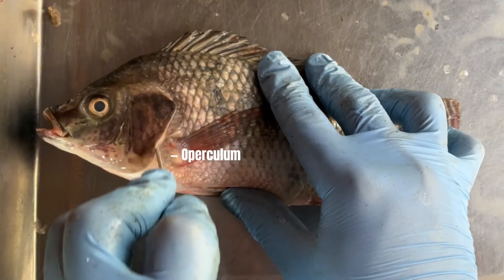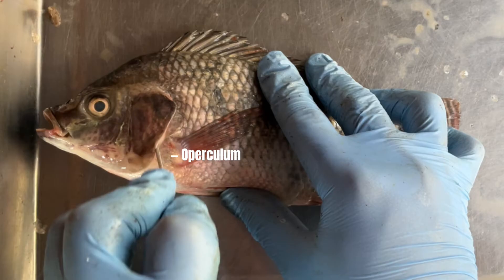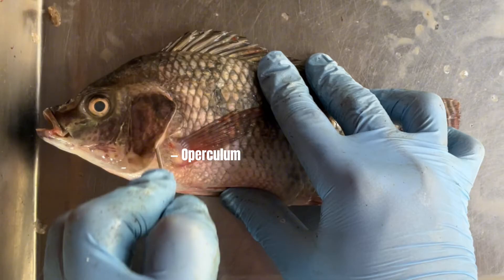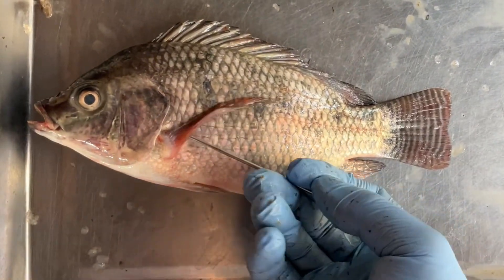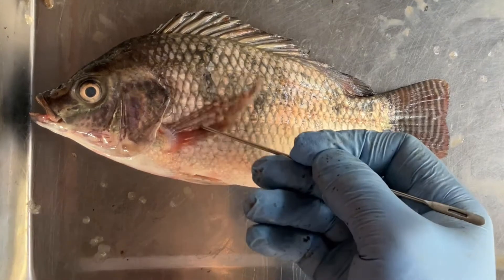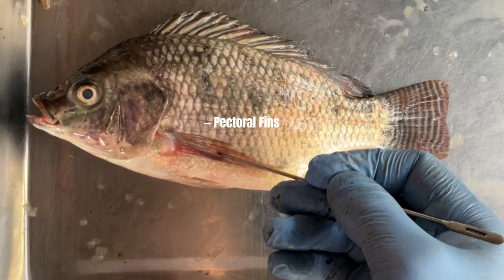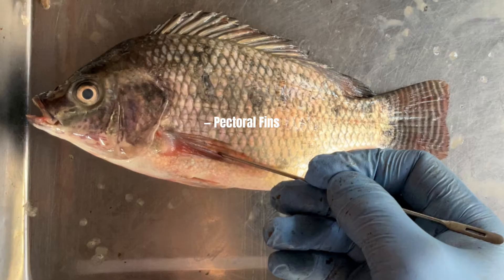The operculum is a bony flap covering the gills of the fish. It plays a crucial role in respiration by protecting the delicate gill filaments and regulating water flow over the gills, helping maintain proper oxygen levels within the fish's body and ensuring efficient gas exchange for survival. The pectoral fins are located on the side of the fish, behind the gills and just below the operculum. They play a crucial role in maneuvering, balancing, and controlling the fish's direction of movement.